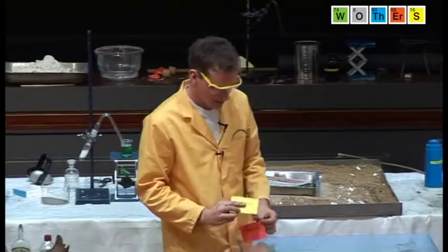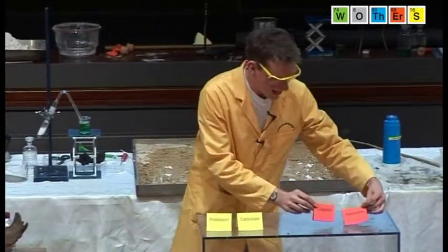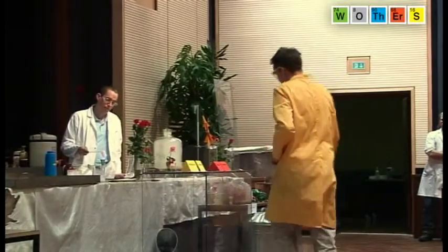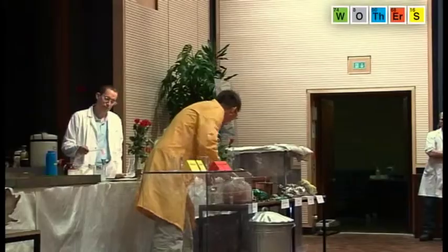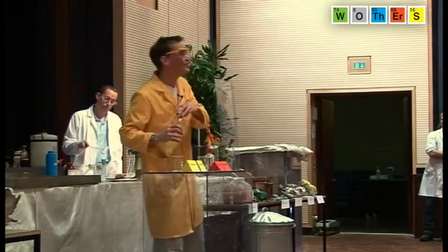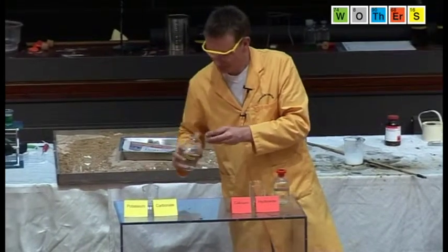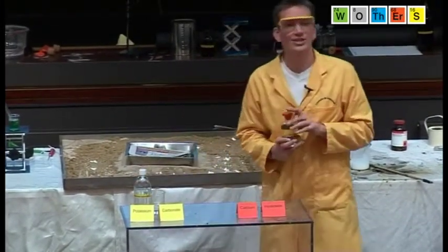we take our potassium carbonate and add it to some calcium hydroxide. These are all in solutions. So I've got some solutions here. So we've got our potassium carbonate. So that goes in here. This is from our potash. And I've got a solution here of the calcium hydroxide.